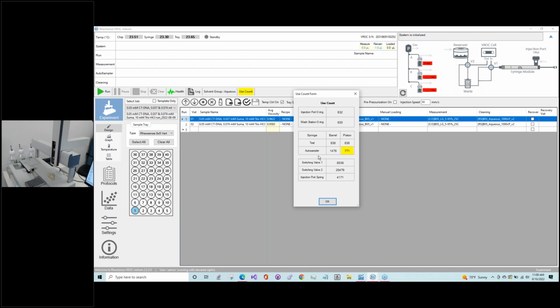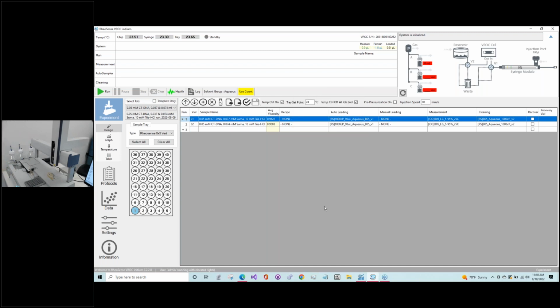If something needed to be changed, it would be highlighted red. And usually that means you'd want to take that piece out and test it, and if it's not working, you need to replace it. Or if it's still good, then it's fine to use. We'll come back to this in a bit. But just to be cautious, because we have optimized the use counts, once it goes red, it's probably best to just go ahead and swap it out, even if you think you can get a little more time, because you don't want to run into a failure and then lose sample or data.